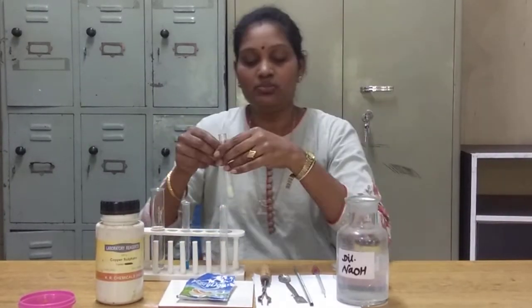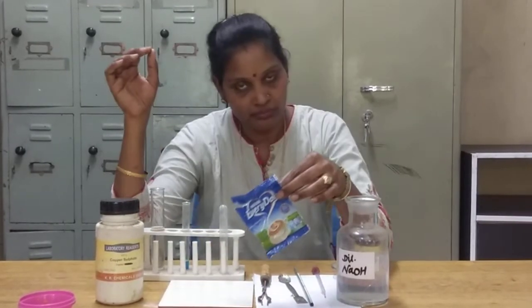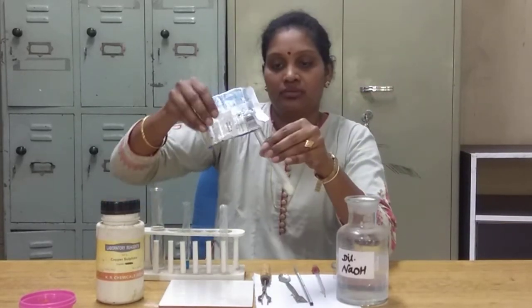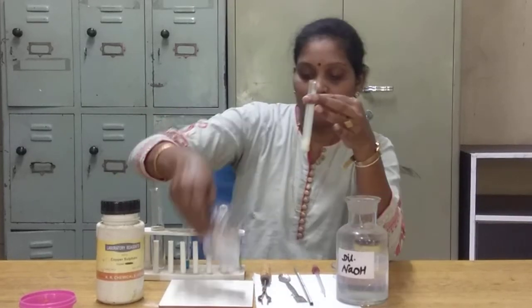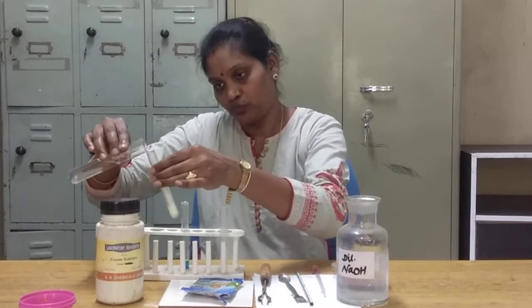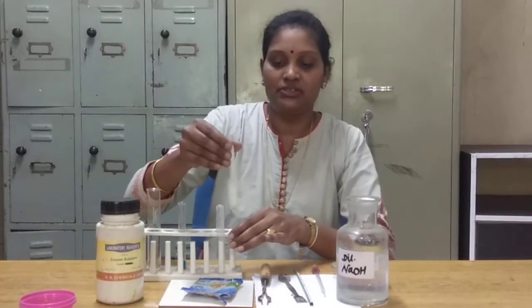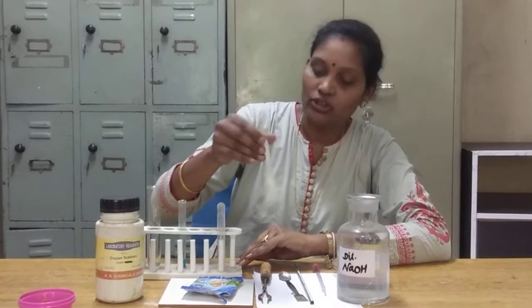Now take the test tube. This is the required food item — this is the milk powder which I have taken for the presence of proteins. Now I will take some quantity of milk powder. We have to add water in it, because whatever test you do for the activity, you have to make it in liquid form. So I have added water in it.